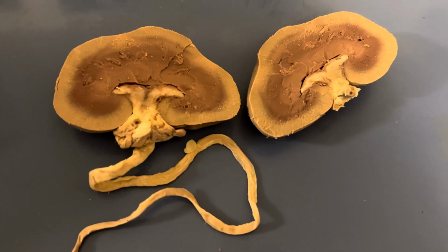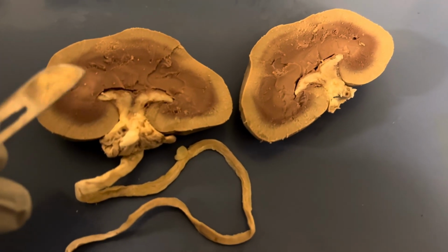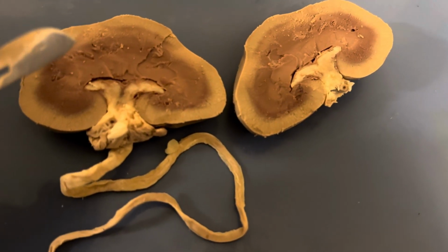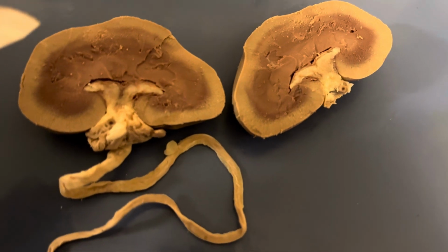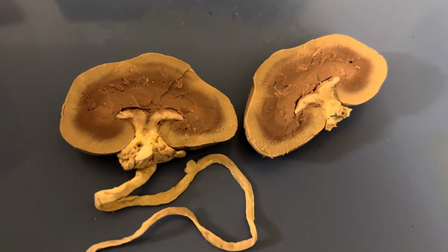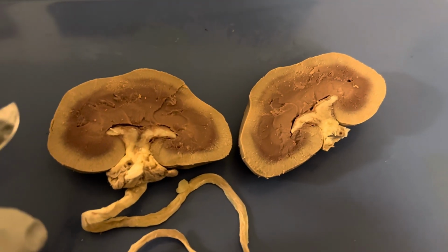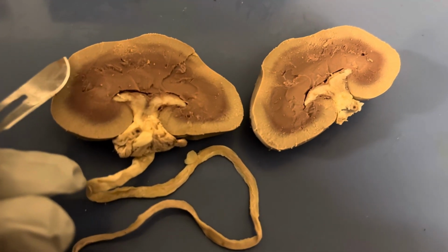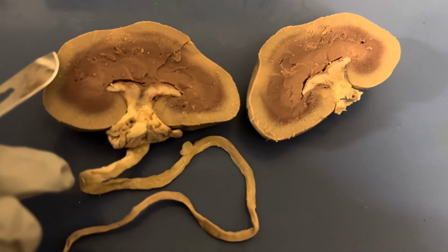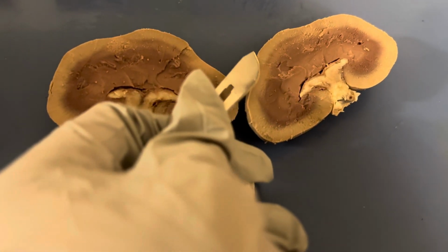The renal lobe consists of the pyramid itself, and then a portion of the cortex at the pyramid base here, and then it's also a portion of the renal column. So just to give you an idea of what a renal lobe or the lobe of the kidney would be, it would be this whole section right here, the pyramid, because this would be the base. So it would be this whole section, just on both sides.